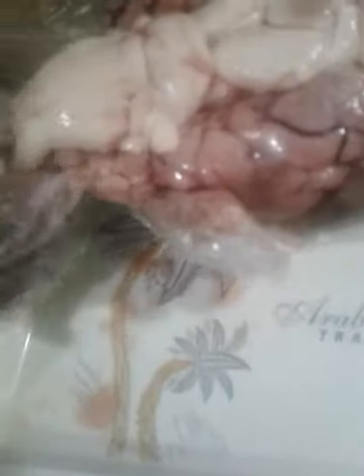This is the lower side of the brain, and this is the upper side of the brain. You can see here, this is the upper side of the brain, and this is the lower side of the brain. So this is the pons, and you will find the medulla oblongata. This structure is known as pons. This is medulla oblongata, and then you will find the brain stem, and finally the spinal cord.